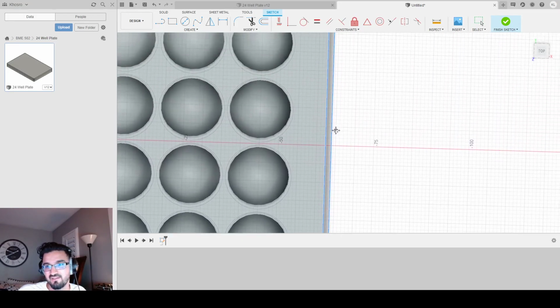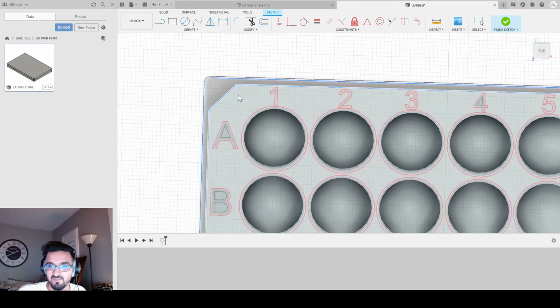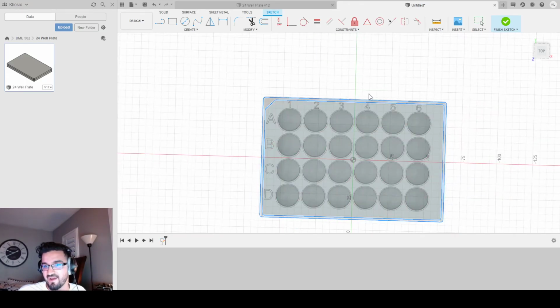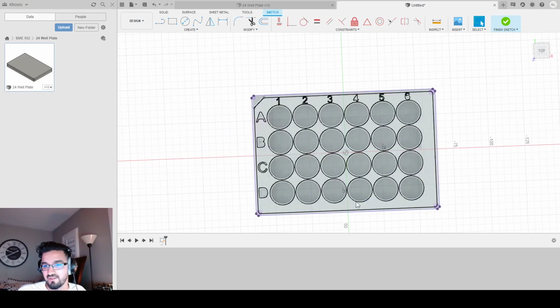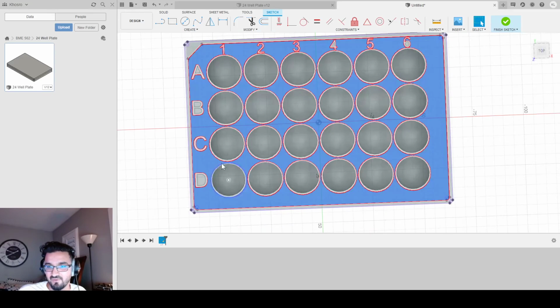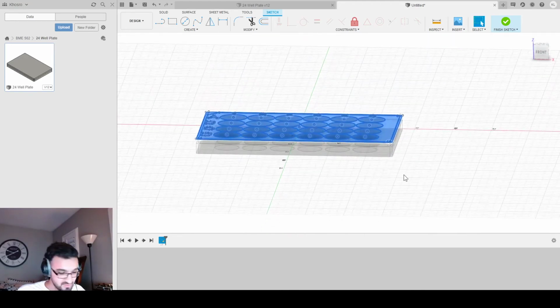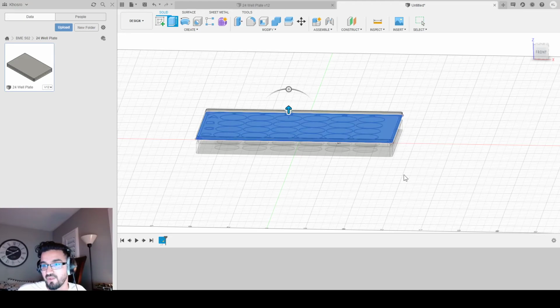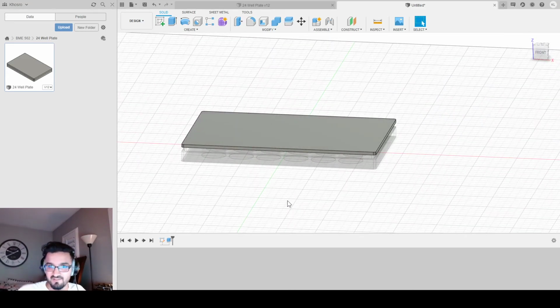Now I could just drag the whole thing and go from there, but I'll get the numbers and the letters and the wells, and I don't really want to do that. This is kind of quicker. And as you can see, I've pretty much got the entire outer perimeter of my plate and the outer perimeter of the upper lip. And I'm going to click OK. So it now has projected those sketches onto my new sketch layer. Now from here, all I got to do is select them. Basically select everything. And I'm going to extrude by 2. And that's going to give us the top of our plate, right? The top of our lid, essentially.